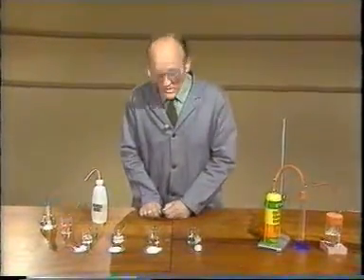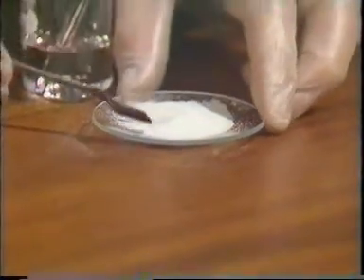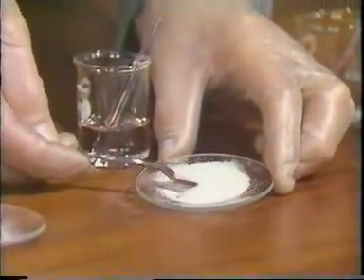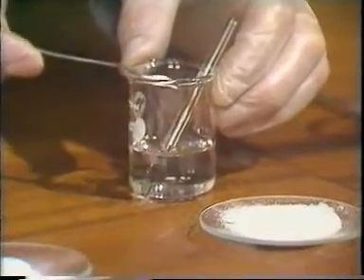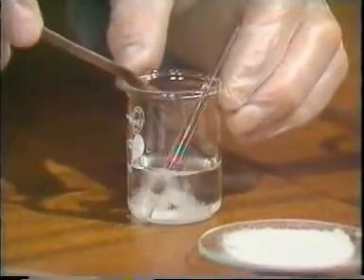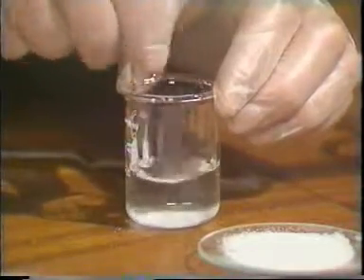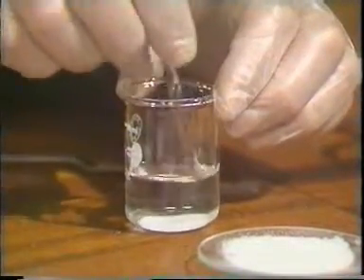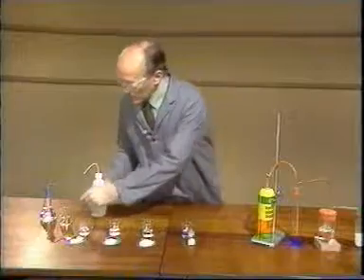Next is silicon dioxide, and this is in fact a sample of purified sand, whitish solid. If I put some of this in the water and stir, it doesn't look as though anything's happening here. I'll check the temperature.